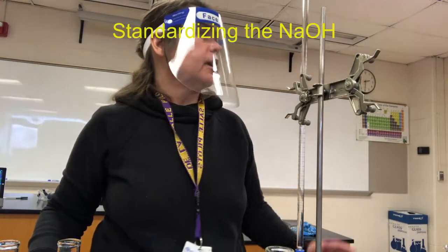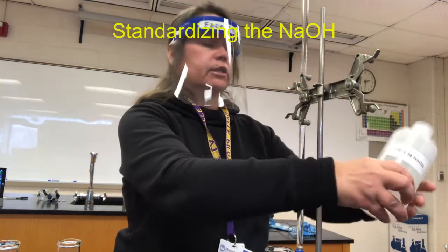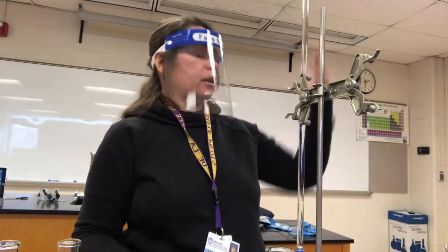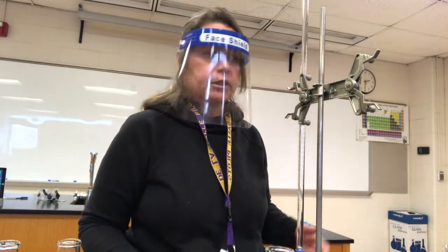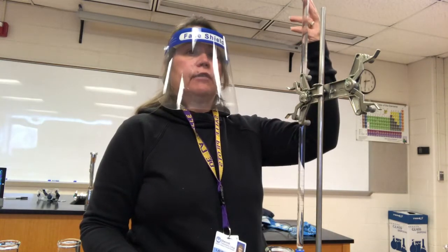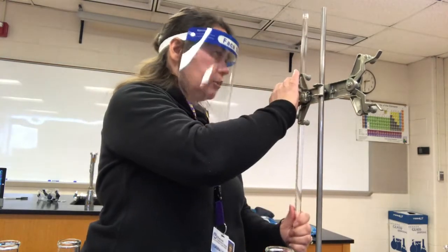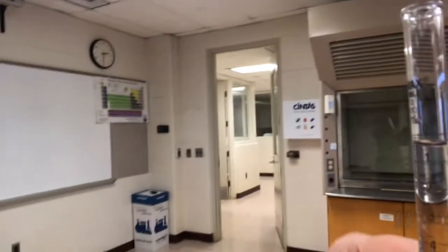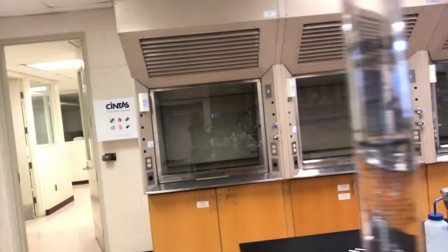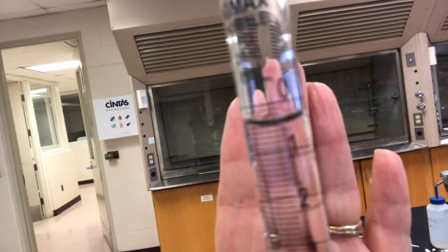Now, in the interest of time, I've rinsed and filled this burette with our 0.1 molar sodium hydroxide prepared solution using proper technique. I ended up rinsing it through 3 times, and then making sure there were no bubbles in the tip, and making sure that the level at the top is below the 0.0. Now I'm going to put you up there. Actually, let me just lower it so it's a little bit easier for me to make sure I get a good shot, and make sure that you can read that you're at. Now, let me see if the numbers, oh, there we go. And sometimes if you put a little darker background there, it's a little bit easier to read.